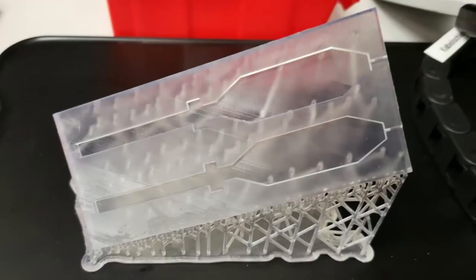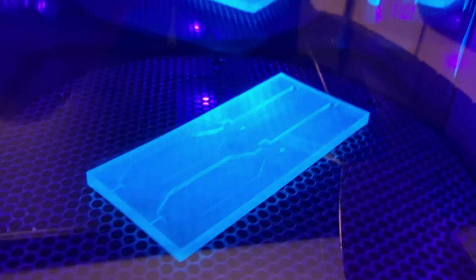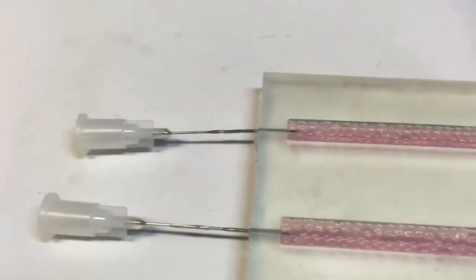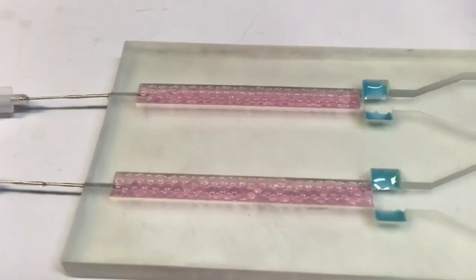For the fabrication of the chip prototype, we used a stereo lithography 3D printer Form 2 for the bottom of the chip. The cannulas and the cell strainer were inserted and fixed with dental glue.